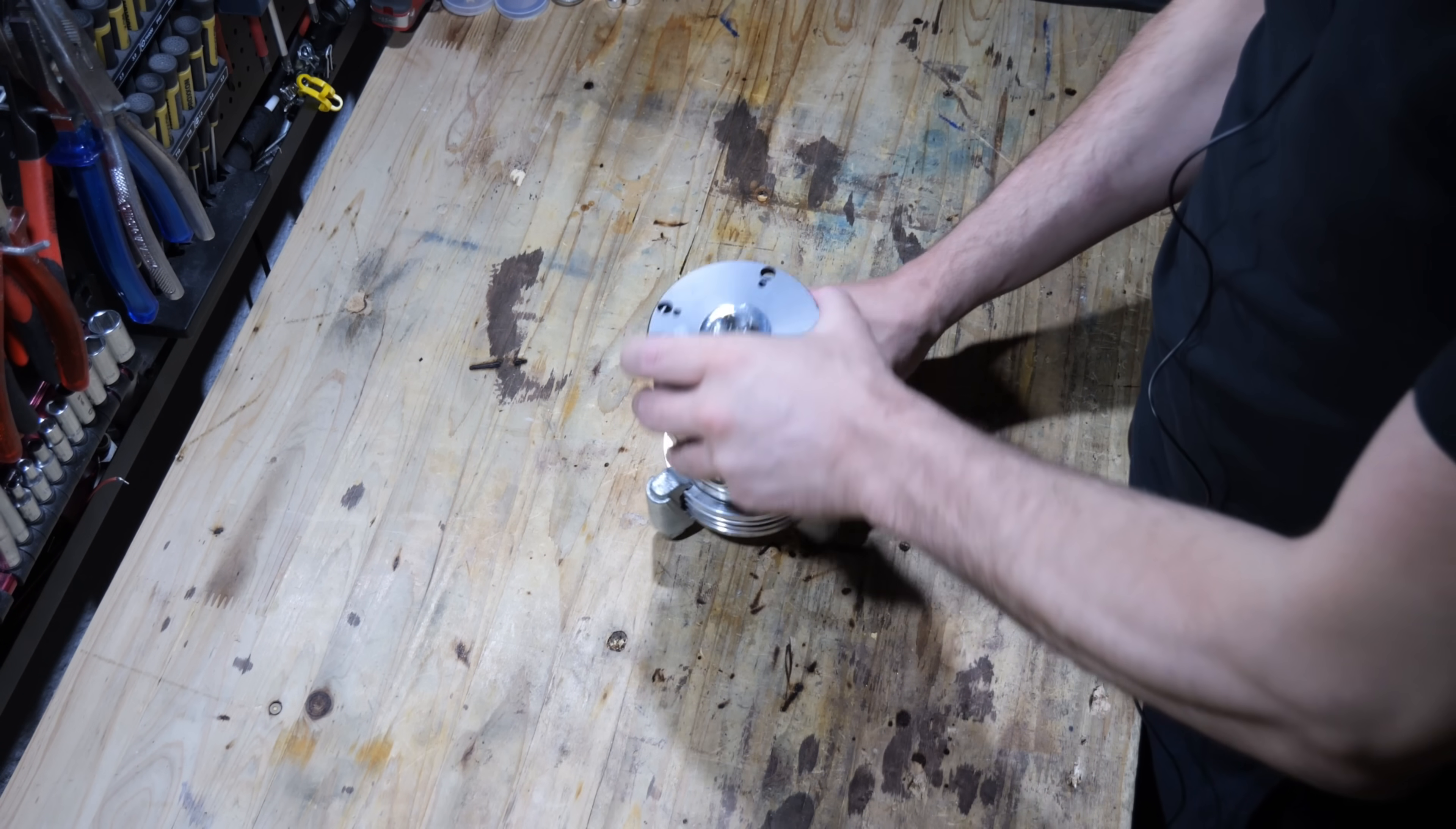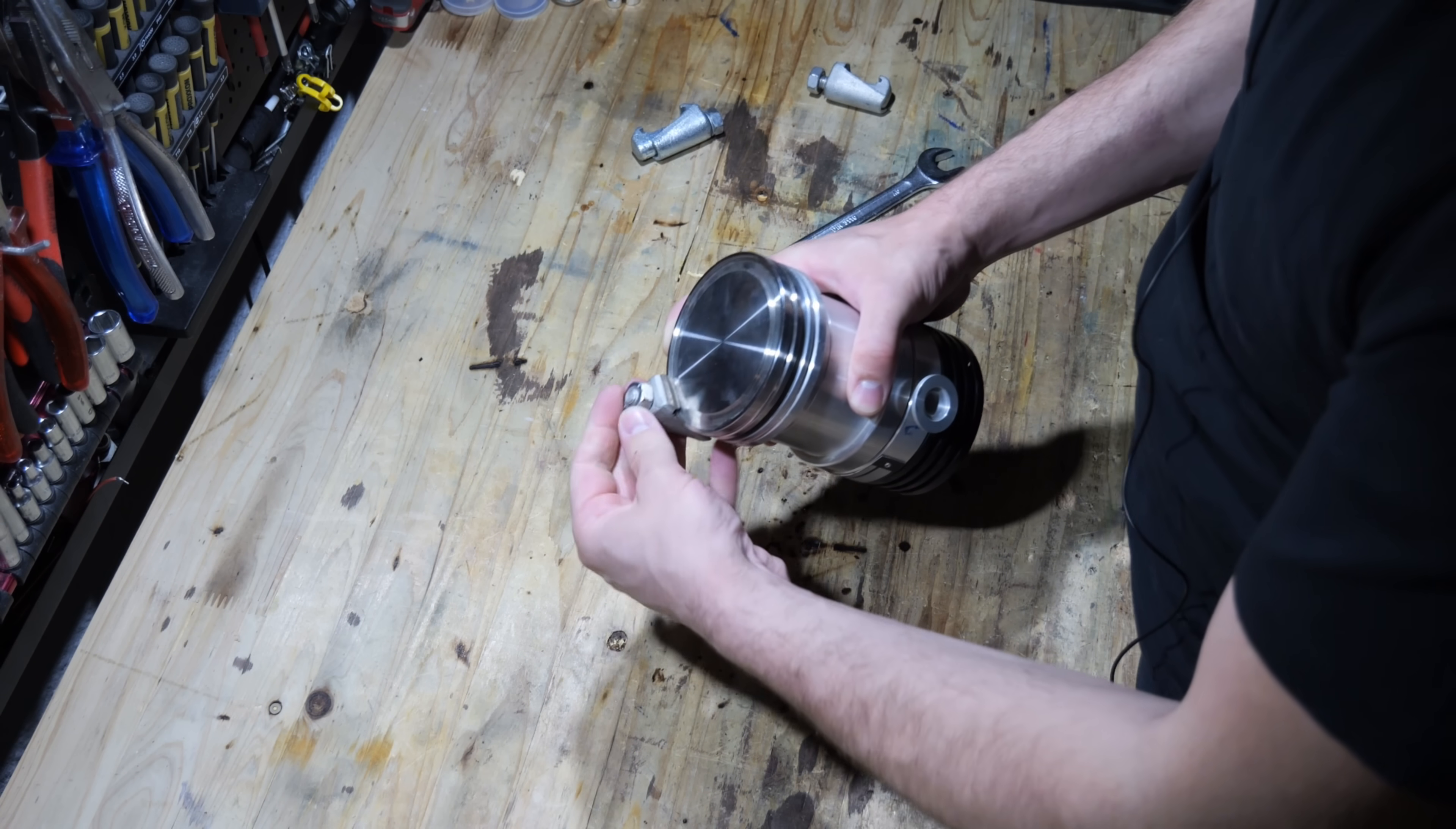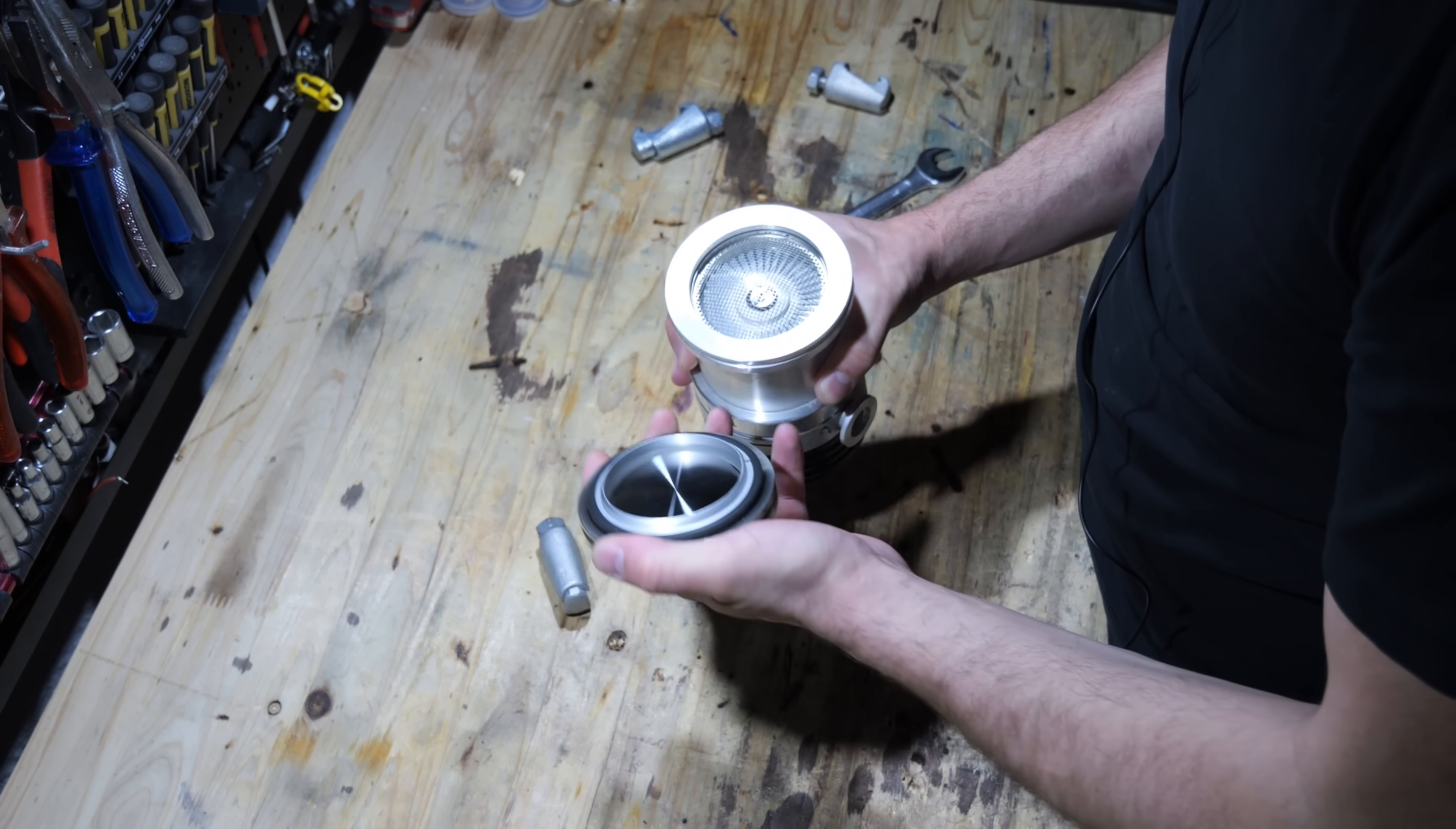I have a new patient. This is a TurboVac 50 turbomolecular pump. This pump was discarded some time ago but the previous owner does not exactly know why. He suspects that it might have a bearing issue but it's uncertain.